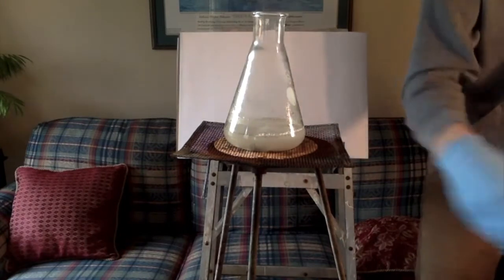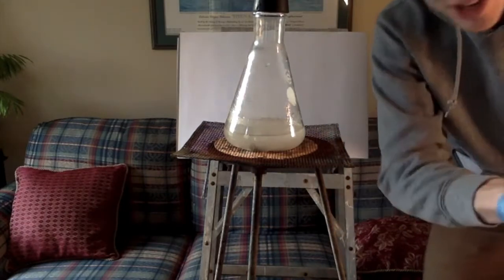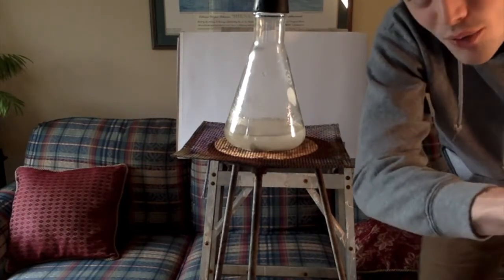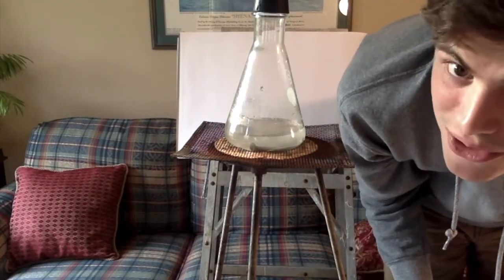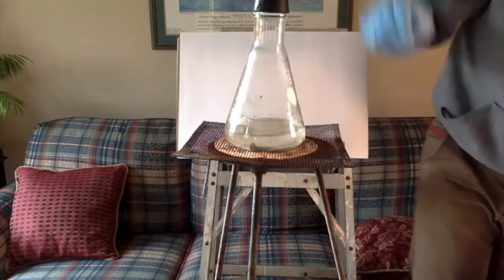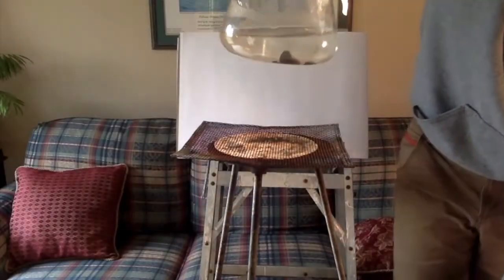All right. Wow. Can you see all the boiling there? If you actually saw some of that gas escape just then before I put the stopper on, that was the hydrogen gas already beginning to escape. This reaction happens extremely quickly, as you can see. Hopefully you can tell with the camera that those nails are still releasing a little bit of hydrogen gas. Most of this reaction happens just at the beginning, but you should be able to see the bubbles that are still coming off of those nails as that zinc strips away.